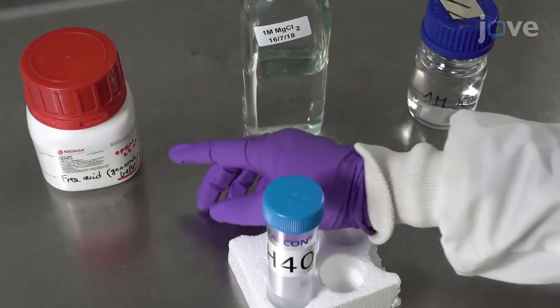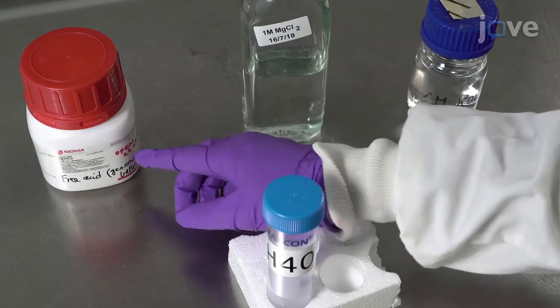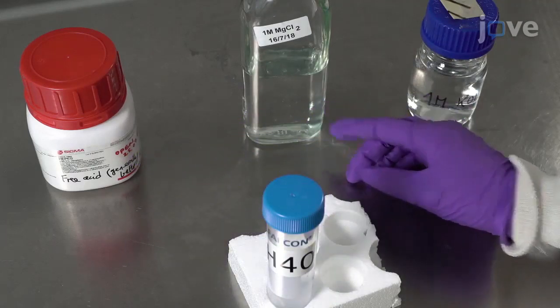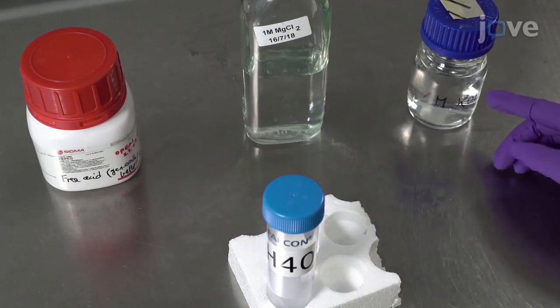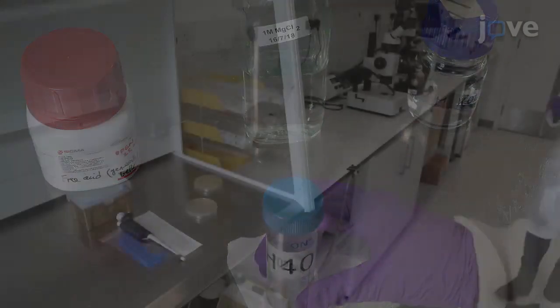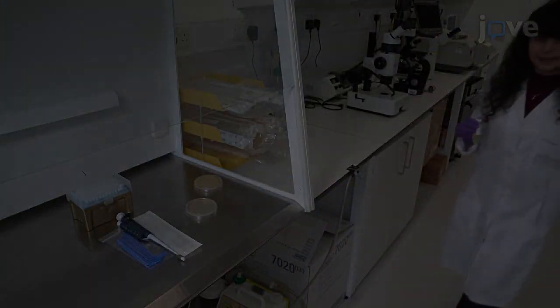After this, prepare the H40 electroporation buffer according to the text protocol. Grow K. aerogenes to confluence.